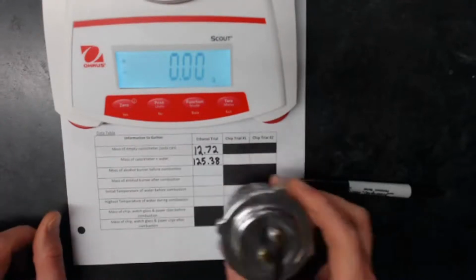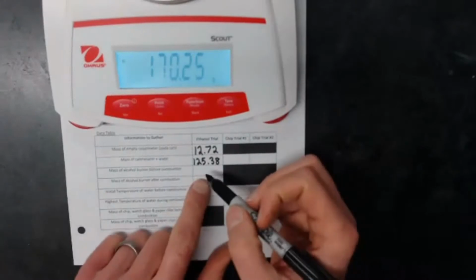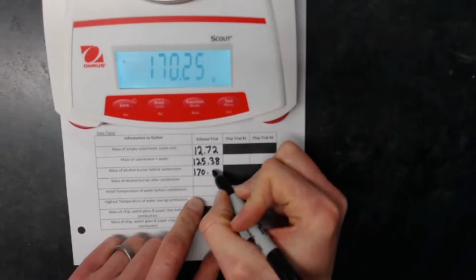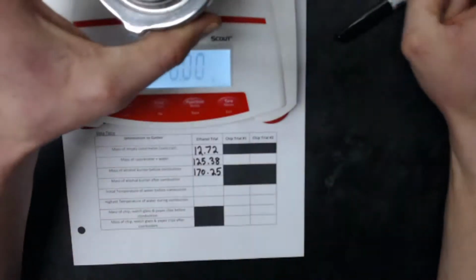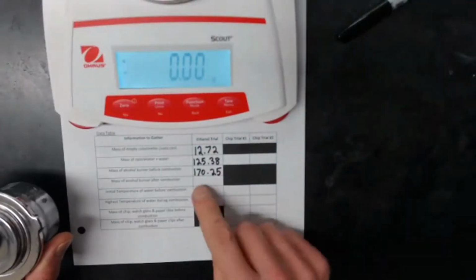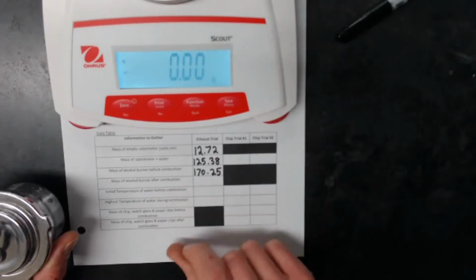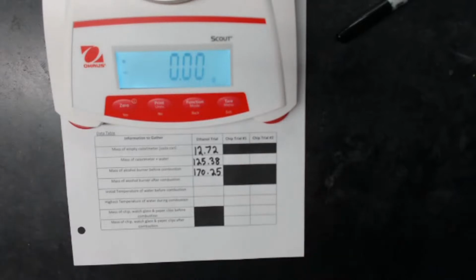Now I've got my burner filled with alcohol, the ethanol I'm using. Got the mass of that before combustion, 170.25. Now I'm going to go ahead and burn this for about 30 seconds and try to funnel all the heat up into the soda can. And hopefully when I weigh this thing again, the mass will drop. It won't drop very much, but however much less it weighs after the reaction, that's how much ethanol, how much alcohol, I used up. All right, so let's switch screens and come back over here.